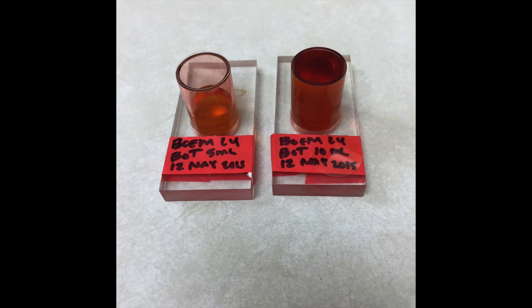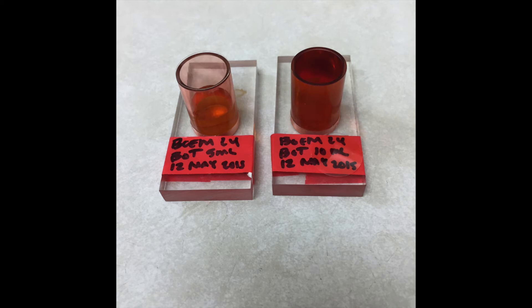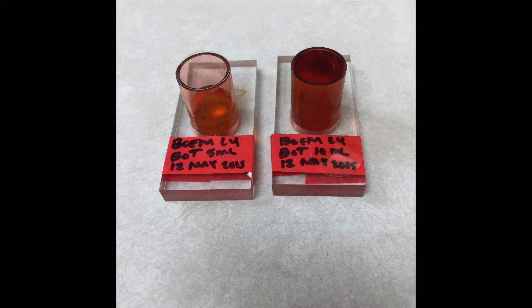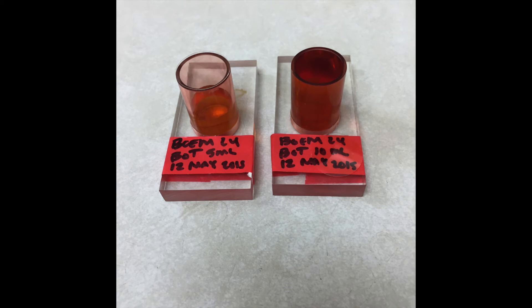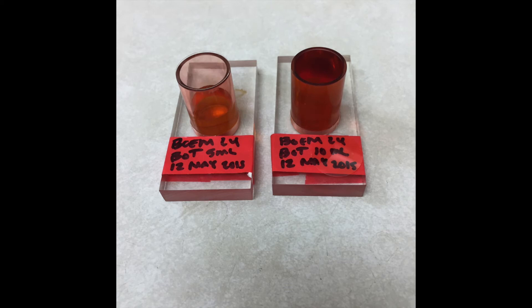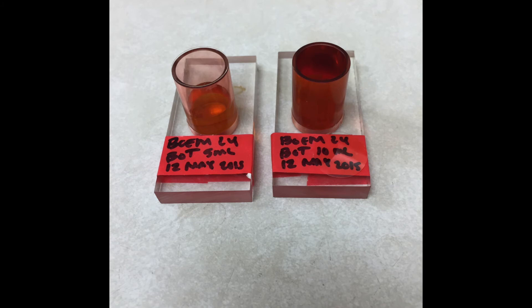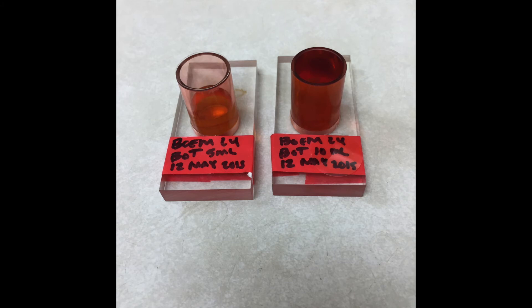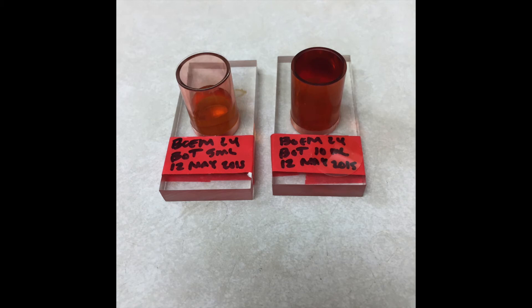It is often a good idea to set up two settling chambers for each sample in case one does not set up correctly or is too dense to observe under the microscope. Typically in our lab, 10 milliliter samples are observed under the microscope because this provides a larger and more diverse water sample. However, this can be a disadvantage because with more water the phytoplankton and debris will be more dense, making it hard to count. In these cases, five milliliters of water are used instead, which lowers the density and makes the phytoplankton species easier to see and identify. This picture shows a 5 milliliter sample set up in a settling chamber on the left and a 10 milliliter sample on the right.